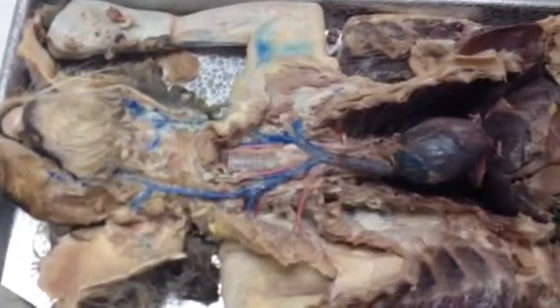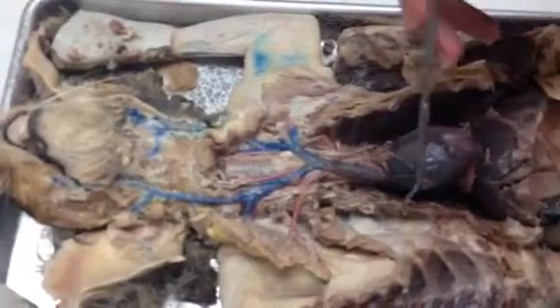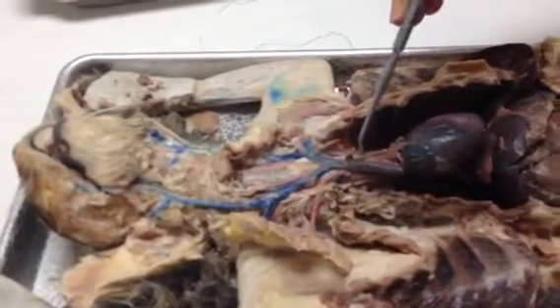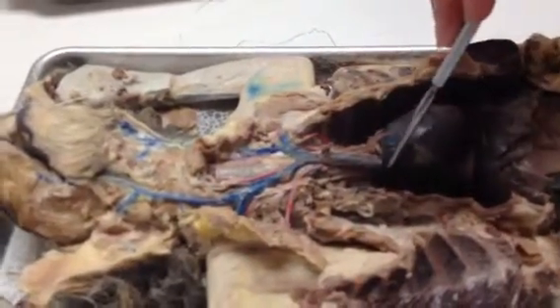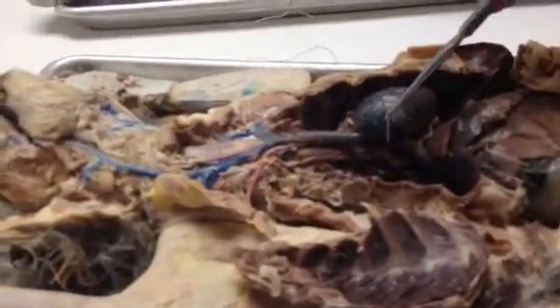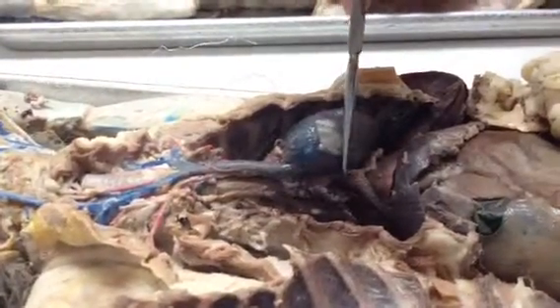Okay. On to the veins. Now for the veins, they are coming out of the right atrium on top of the heart here, and this vein right here is called the anterior vena cava. Very good. And off the anterior vena cava, there is an arch that comes off of it, which is called the azygos, which has been cut in this cat, but we can see part of it right there, and it would connect to this part right here, and it runs along the vertebrae of the cat underneath.